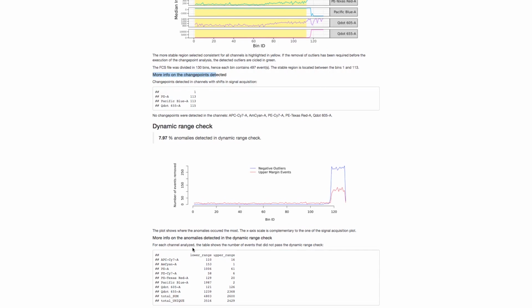And so then we can also turn our attention to this final representation of information, which is for the dynamic range check. We have the lower boundary and the upper boundary, and it tells us how many events are being rejected in each of these. So for example, we can see based on APC-Cy7 that 110 events are being rejected as being too negative, as in they're considered a negative outlier. And for the positive outliers, 16 are being rejected. We can see the behavior of this analysis on each channel, and then we can get the totals.